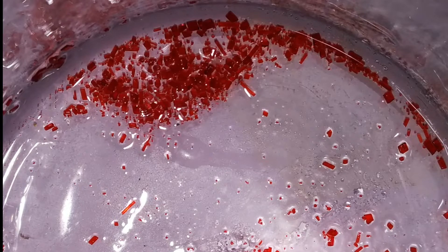So I need to find out what the exact mechanism is to make these red colored crystals appear. This was just some random shot.